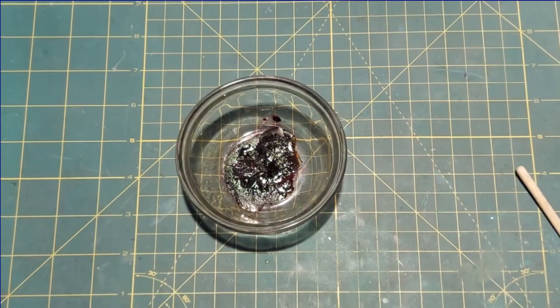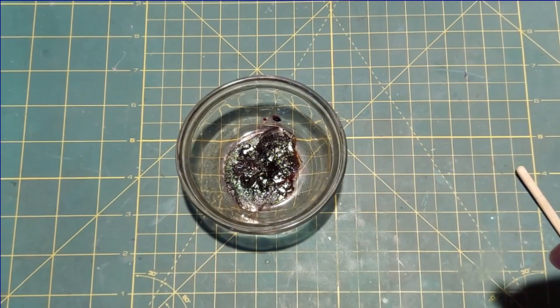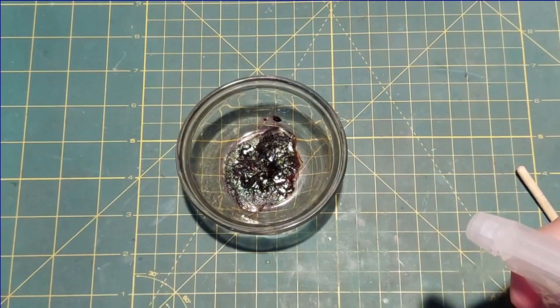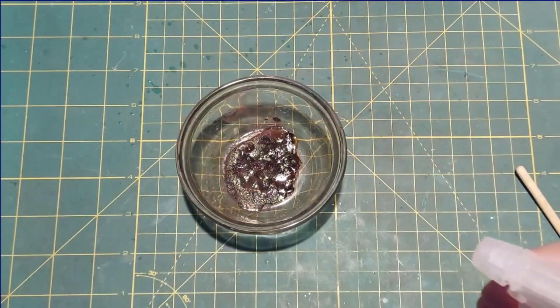I have some 91% isopropyl alcohol here. I'm going to spray it out of a bottle over that. Let's do that. Let's do that one more time.